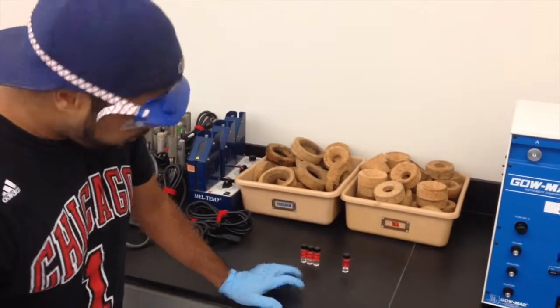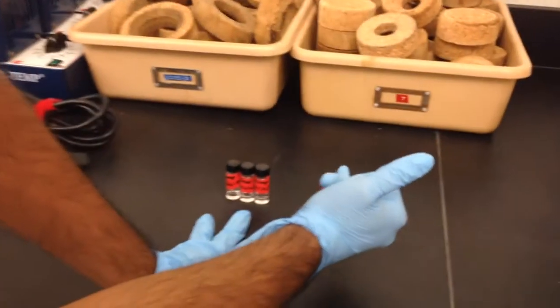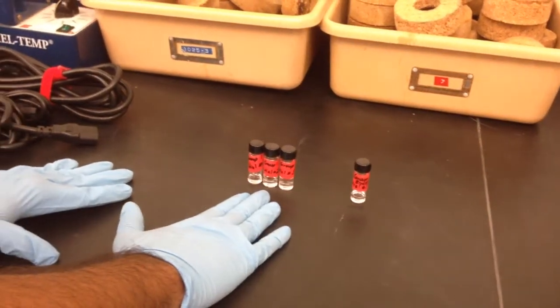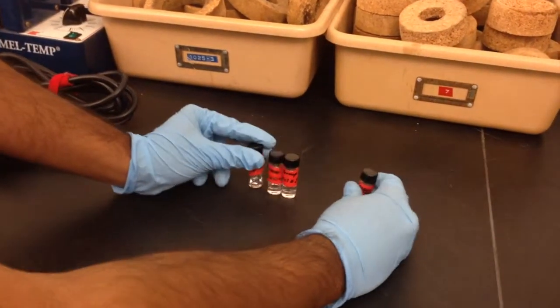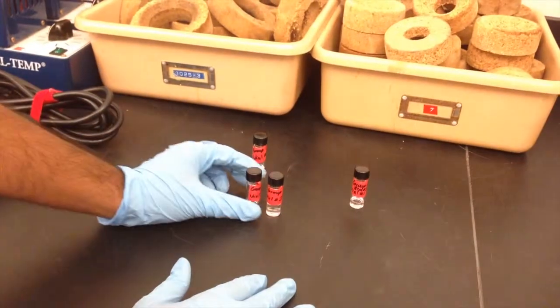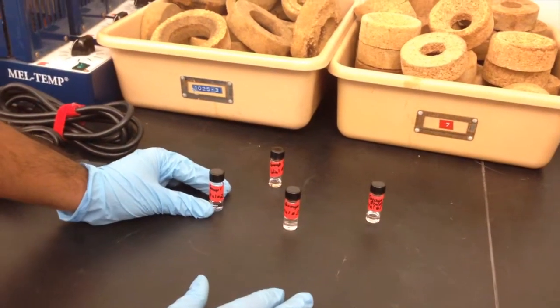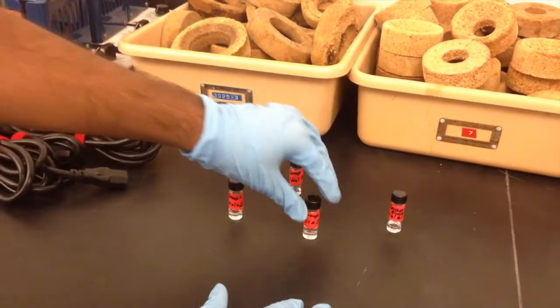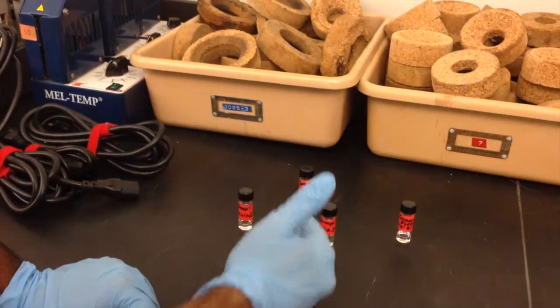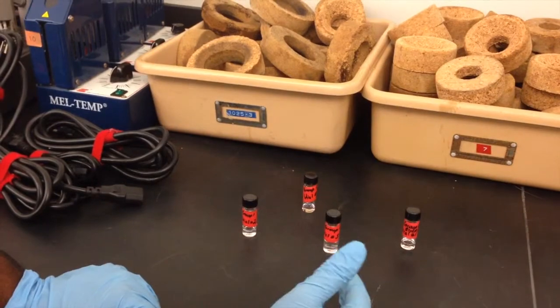So by the end of our experiment, we currently have 4 vials. 1 vial that we collected for our sample of simple distillation, and then 3 vials that we collected at 3 different points for fractional distillation. In simple and fractional, these 2 vials right here were the first few drops that were collected. This right here is after the temperature got to 85 degrees, and this was after the temperature reached 120 degrees. That way we can see what the concentrations of each are at different steps through the fractional distillation.